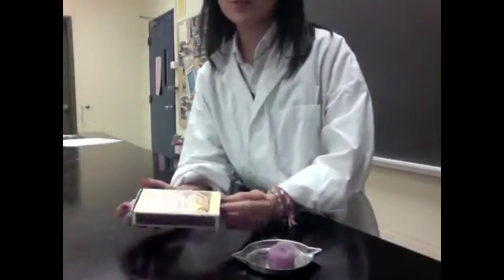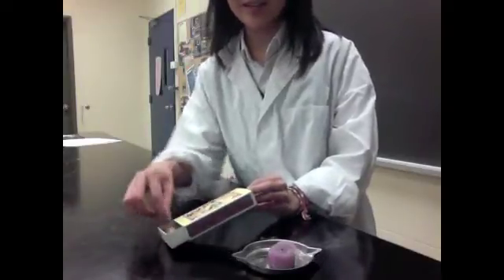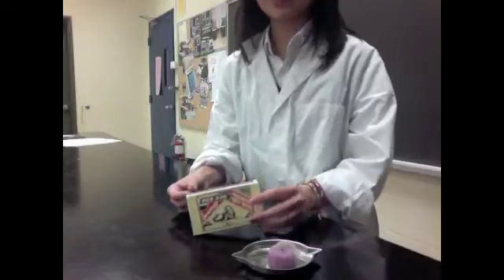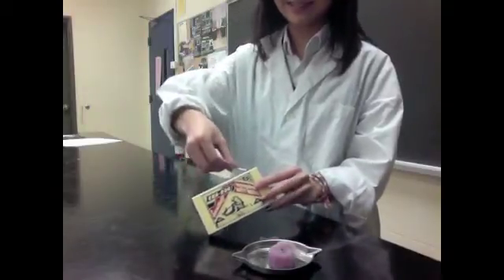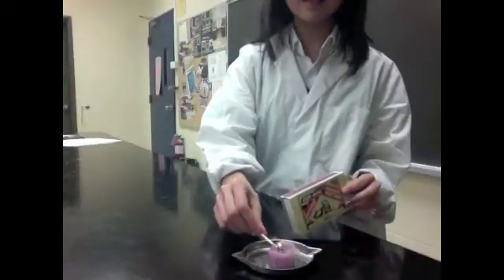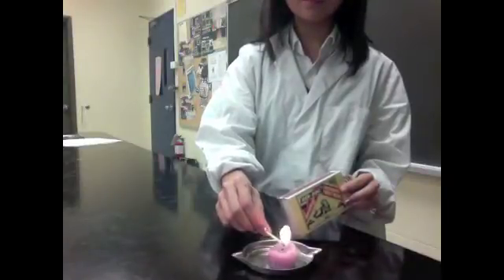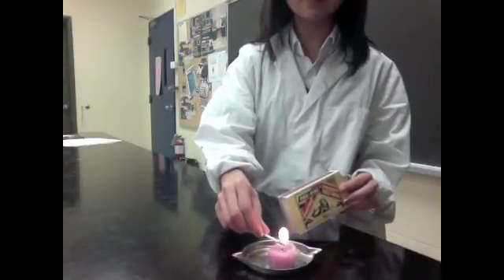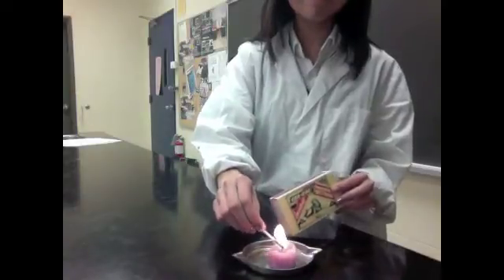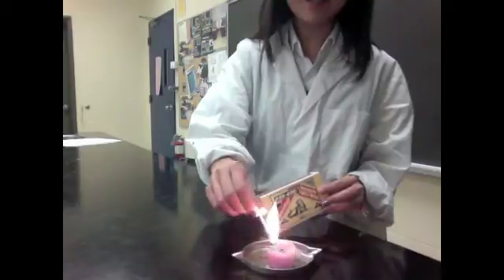To begin this experiment, we're going to need to get a match and light the candle. Let's hope this turns out okay. My candle doesn't like to light up. Any time now. It is burning up.